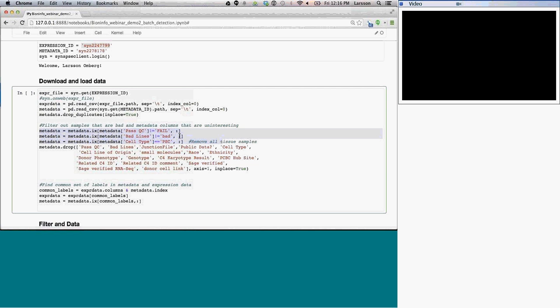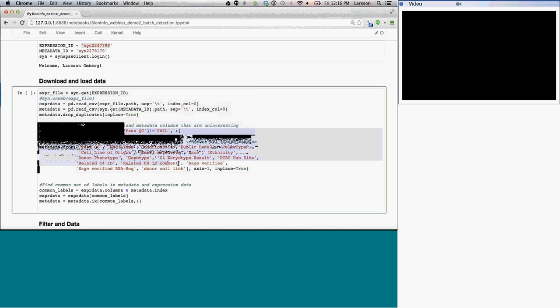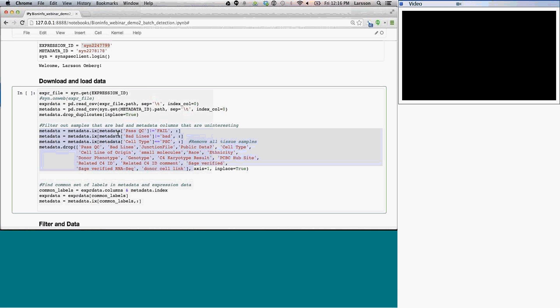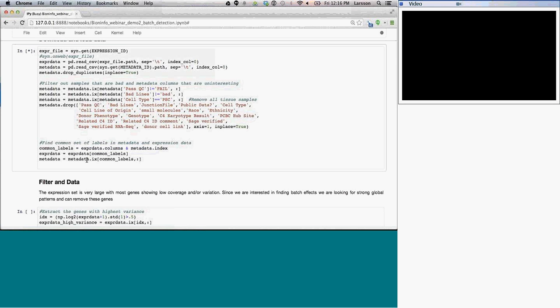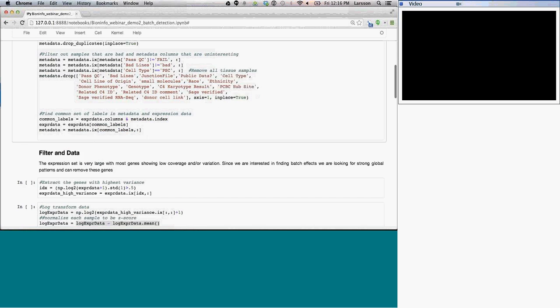And then I also only keep those that are stem cells. There are some samples in here that are from tissues, but I'm not interested in those. And there's a lot of information in the metadata that is not relevant for this analysis, so I drop those to make the metadata easier to understand. And the last thing I do here is find those columns in the metadata and the expression data that are the same, and I extract only the data that we have both expression data and metadata for. So I run that, it's now downloading from Synapse, and then doing the filtering, and eventually also the pairing up of the samples.